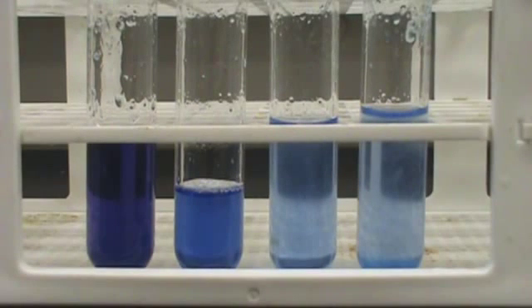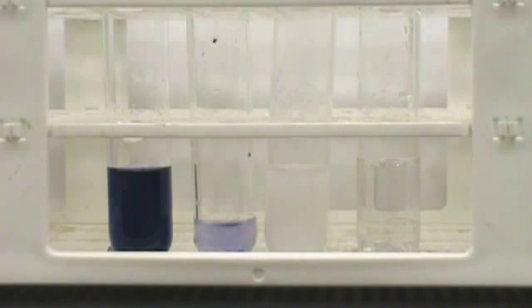In the Biuret test, you will be testing to determine if your casein is indeed a protein and not an amino acid or a single dipeptide. A violet color is positive for a protein. The Ninhydrin test is used to detect amino acids and most proteins. It will turn a blue-violet color, and proline or hydroxyproline produces a yellow color.